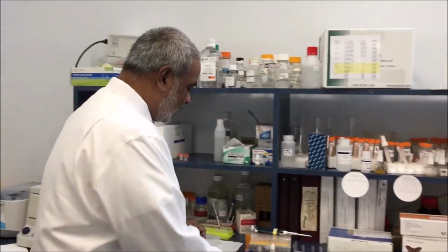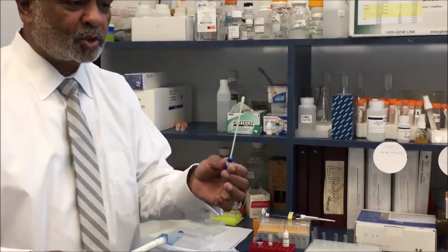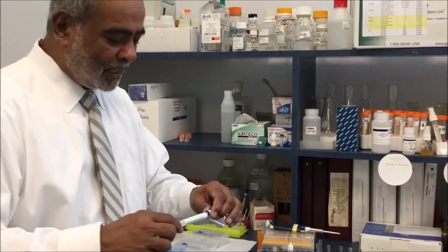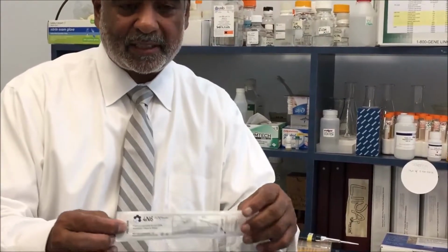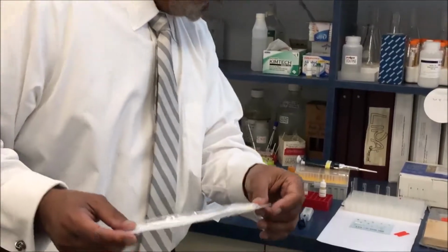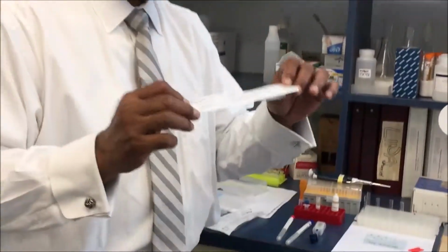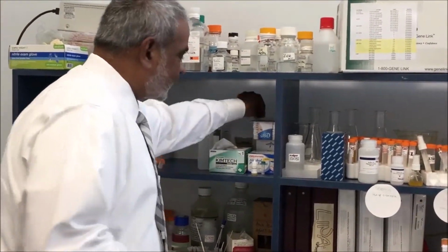Hi, this is session 2 of the sample collection devices. In this session, we are going to introduce a new sample collection device which we call the Omni-Matrix. In the previous session, we showed you the sample collection devices which are all based on a swab: the nylon swab, rayon swabs and so on. I will show you the most common one, the forensic swab, which is flocked at the end over here, and we will open it later during the actual use.